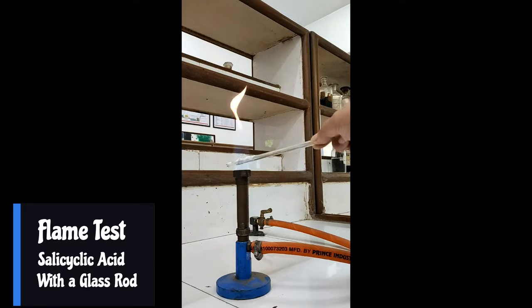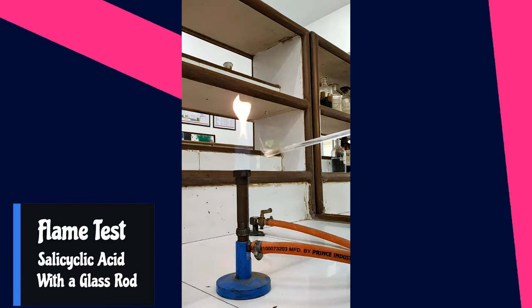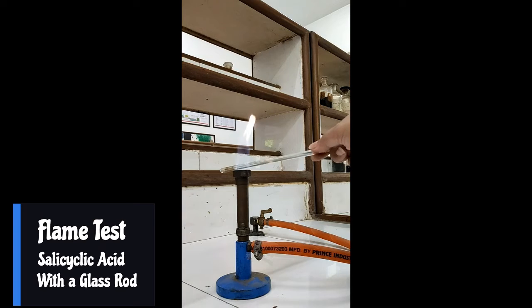In this video, I'll tell you how to confirm salicylic acid. In previous series, you've seen many compounds and you might have noticed the steps are similar. Here also, you have to start with a flame test.